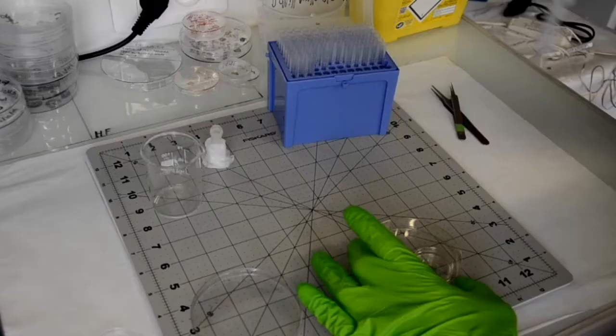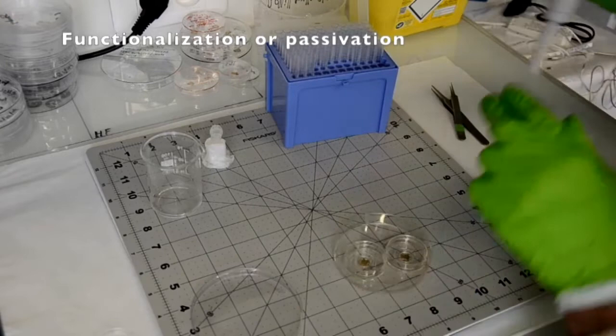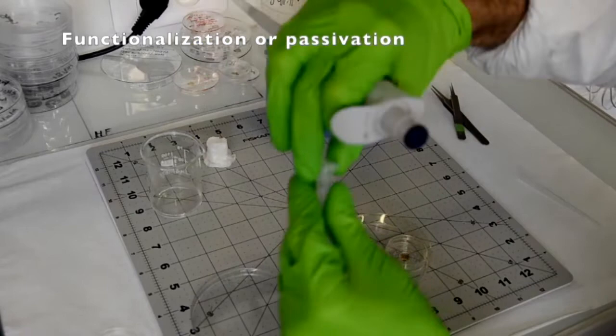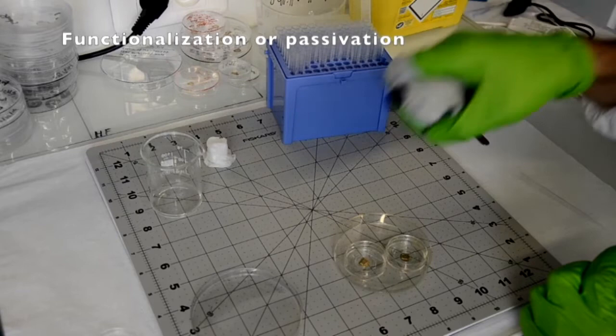Then we need to functionalize or passivate our device according to the sample we want to culture. In our case, we chose to passivate our device with a solution of 0.5% lipidure diluted in pure ethanol. Lipidure is a very robust anti-fouling agent that will prevent any cell adhesion on the wells for a very long time, up to a month, in order to grow suspended spheroids. One just has to remove the ethanol, pour the lipidure solution onto the device, and allow it to completely evaporate under a sterile hood, usually in about 2 hours, to form a homogeneous anti-fouling coating on the device.